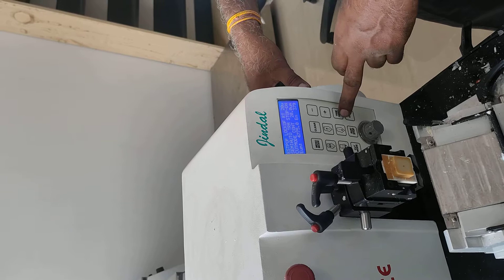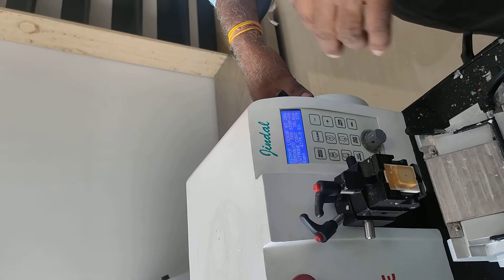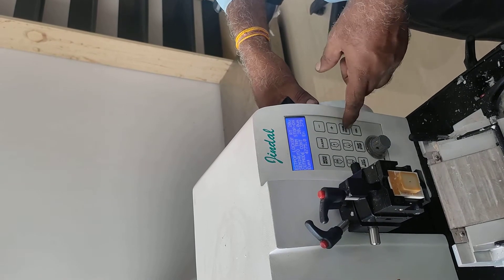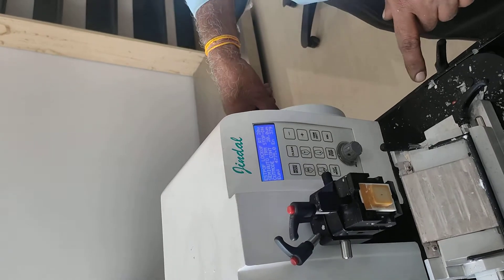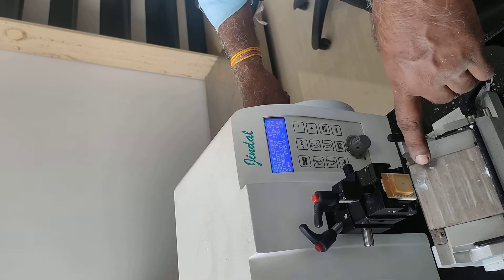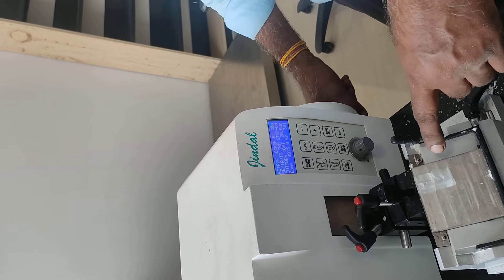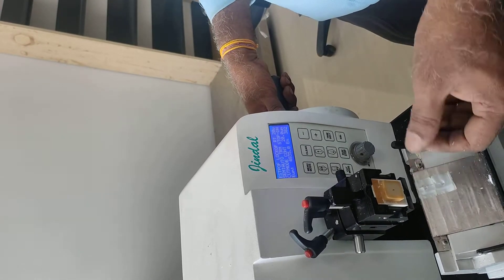Suppose that we have now done our block without trimming. We have just put it into the block and we have decided to select Trim. The trim selected is 20 micron selection. Now what we will cut is the 20 micron cut. This is the 5 micron first read. Now, what we have seen is the 20 micron cut is the tissue. This is flat, which we can make our slides from.